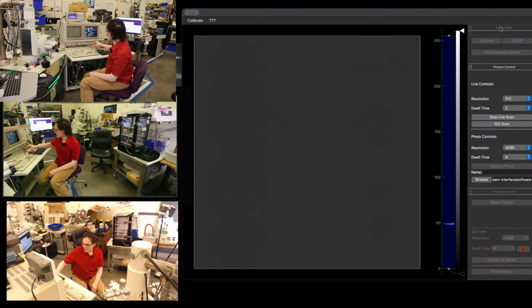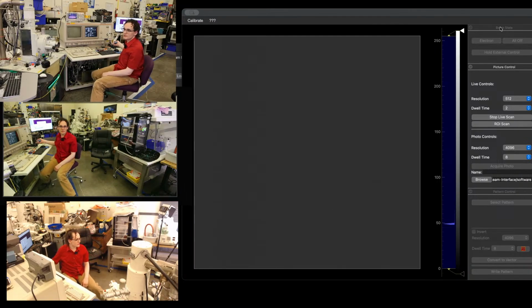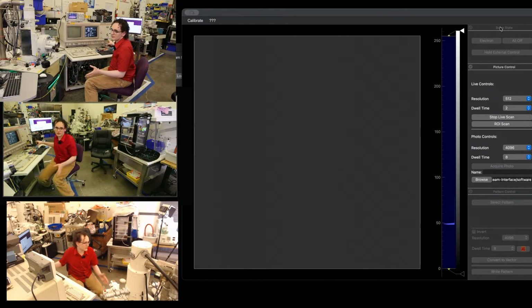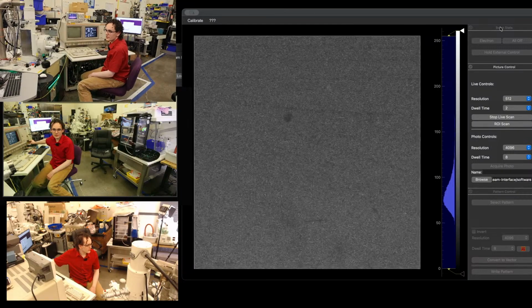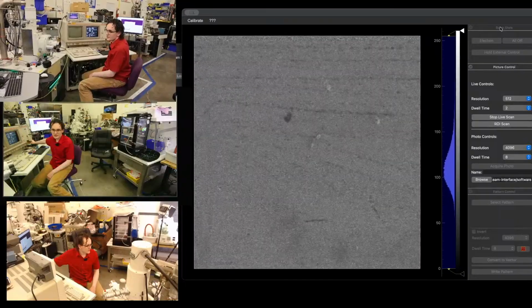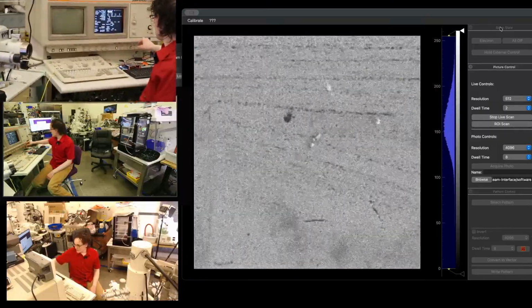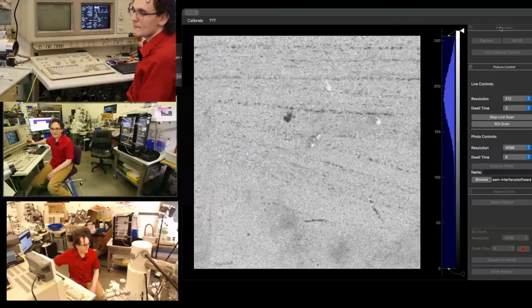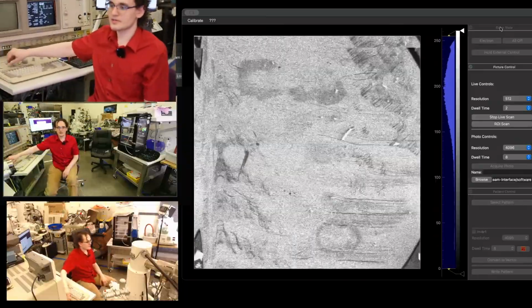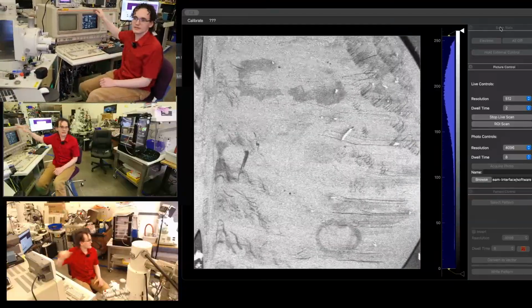So now we can see our brightness control. So brightness is working great, love that. Our little internal switch is flipped to external, so that's going to enable the Open Beam Interface scan inputs. And we can start saturating our filament. So we're starting to get some electrons going up. That's our false peak, and we'll keep going. And there's our actual peak. So now we're just going to maximize that. And there we go. That's Open Beam Interface. And we are scanning. We got an image. So that is the basics of how you install OBI on an SEM, the likes of a 6400.